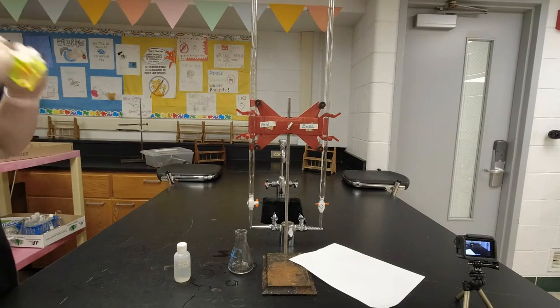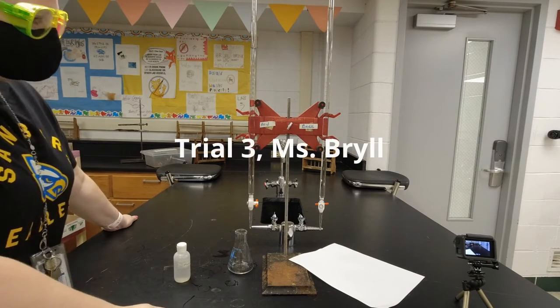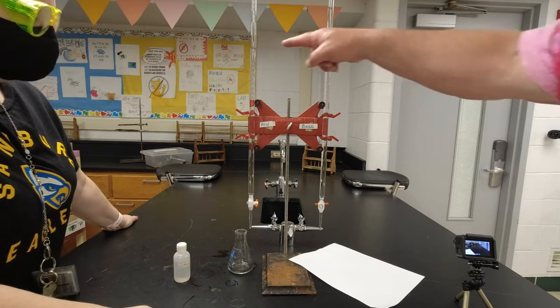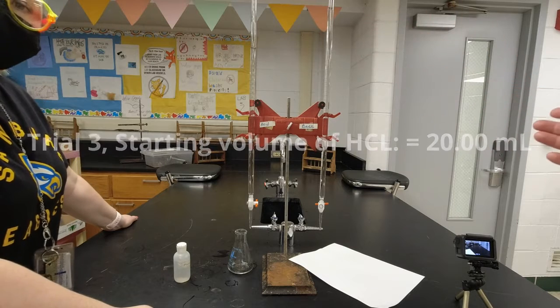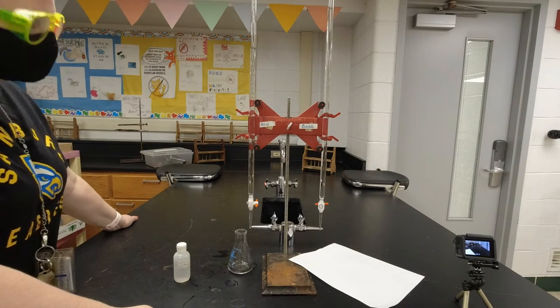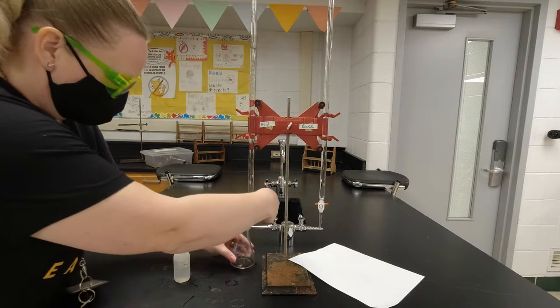All right, so the next team member that we have here is Ms. Brill. And what she's going to do is she's going to do the same lab. She's doing trial 3. And so here she started at 20.00 milliliters, and she's going to try to run it down to 30. But again, it doesn't have to be exact because our calculation is going to take care of it. The calculation is easier if we get exactly on 30, but it doesn't have to be right on 30. All right, so go ahead, Ms. Brill.